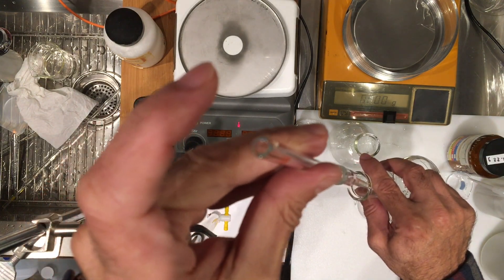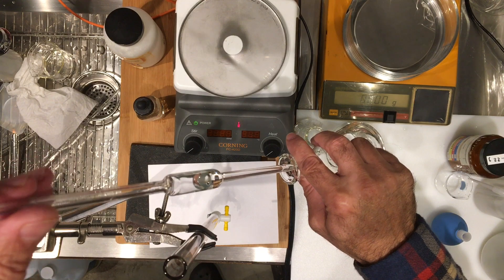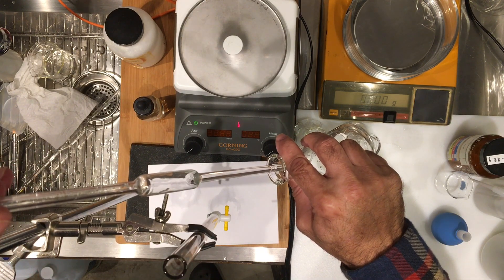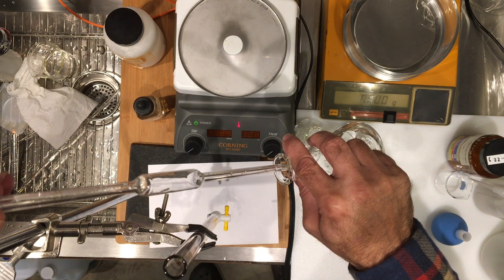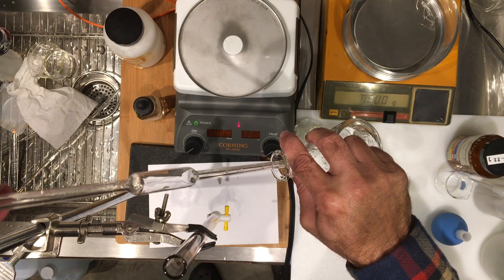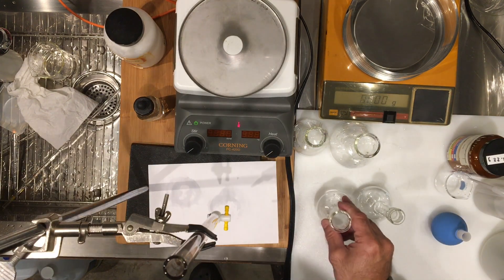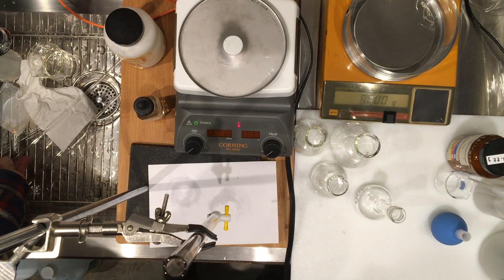I'm just letting it drain. The tip of the pipette is touching the side of the flask — that's how you properly transfer the volume. And there are my three 10 mL portions of diluted vinegar.